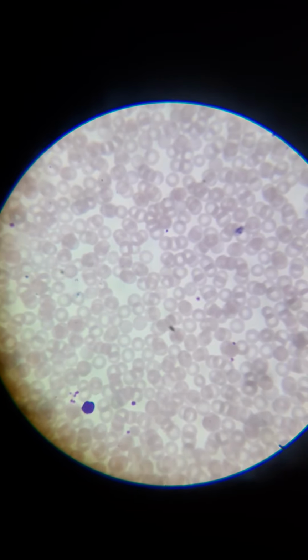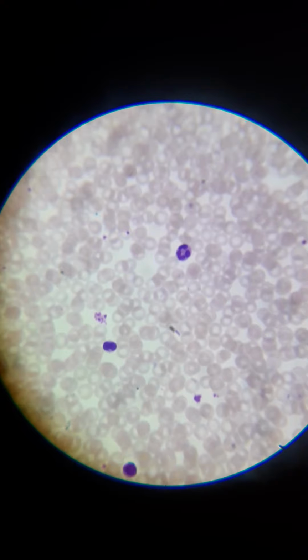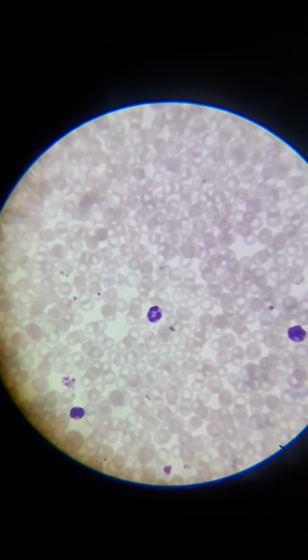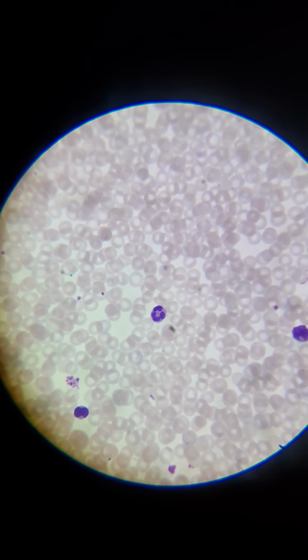Let me see if I can find a neutrophil. I saw some, actually, that's one right there. So some of these big purple ones, you can see the dark shape inside the lighter purple. That is what we call a PMN type of cell, or polymorphonuclear. The nucleus, that whole darker shade of purple, is actually a nucleus, and it, what was I getting at? So yeah, polymorphonuclear. It's not a regular nucleus. Its morphology is multiple, poly. And they're always going to be shaped a little bit different. It's never the exact same.